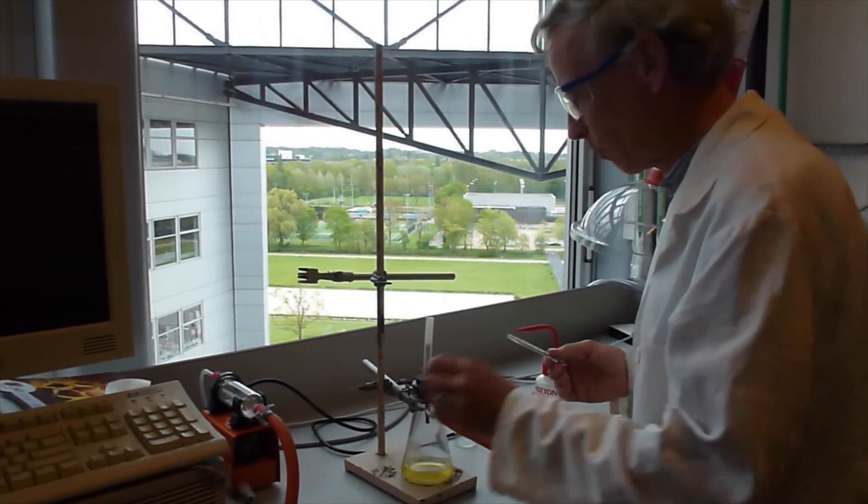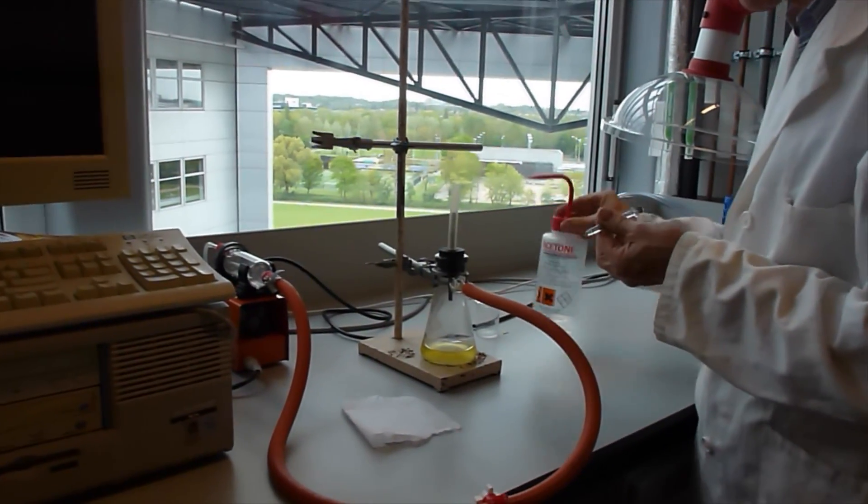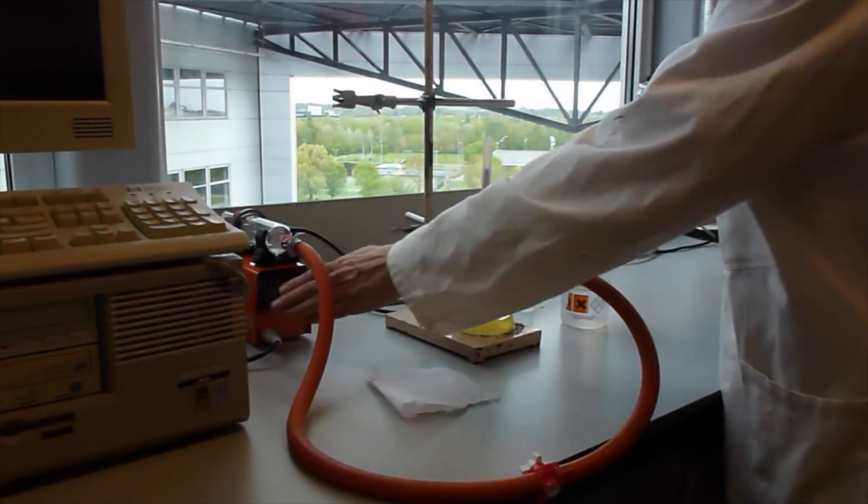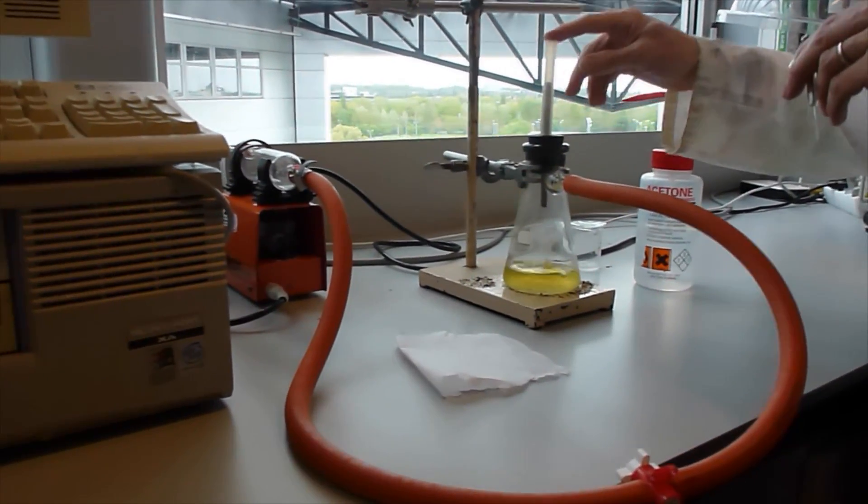You need the syringe, you need a piece of paper, the station for cleaning your syringe and a bottle of acetone. Turn on the small vacuum pump that creates some suction here.